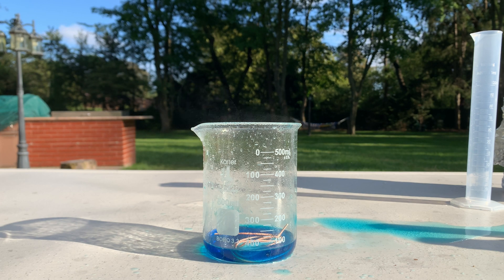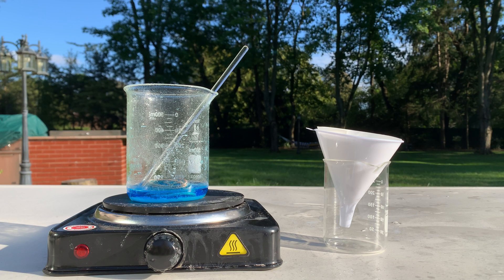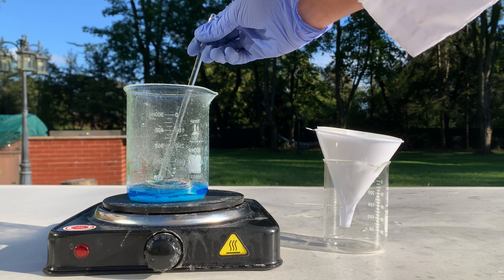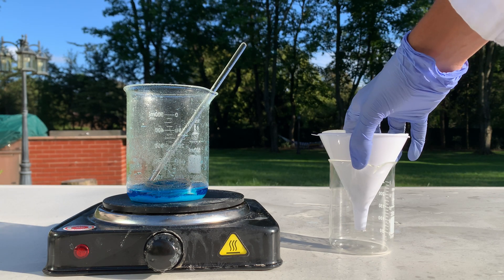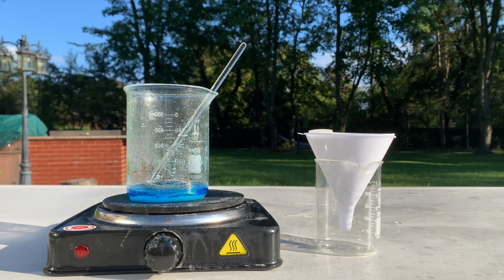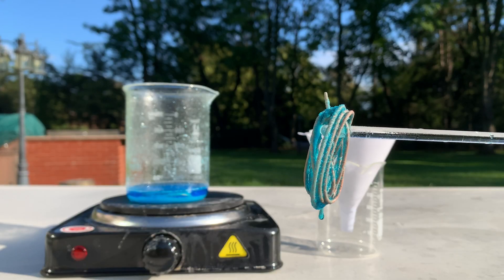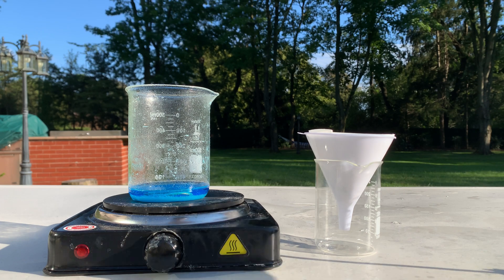Look at that beautiful dark blue color. I'm going to let this sit for a bit and then boil off the excess water to get some solid copper sulfate. So I let the reaction sit for around 15 minutes and we can already see some copper sulfate has precipitated. I want to boil off some of the excess hydrogen peroxide — the sulfuric acid won't really boil off — so we're just going to filter the solution through some filter paper. First, let me take out the copper metal. We have copper sulfate crystals on the copper metal.